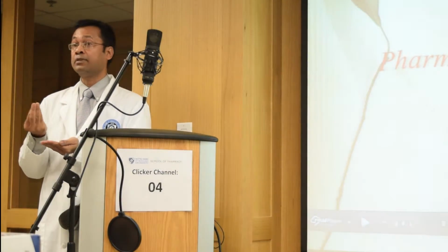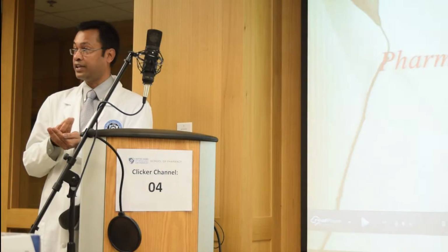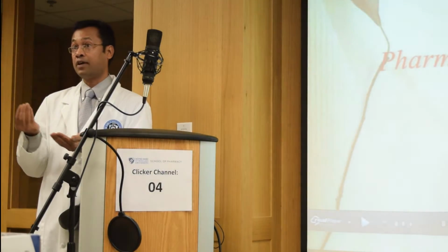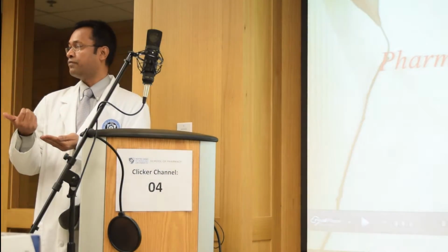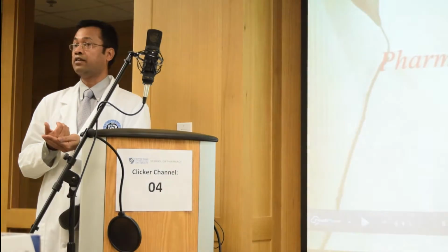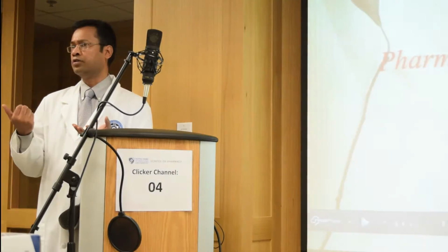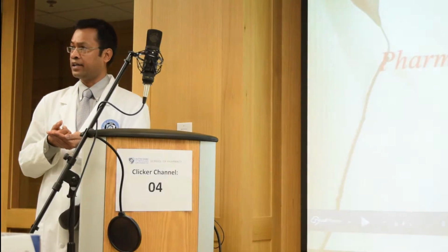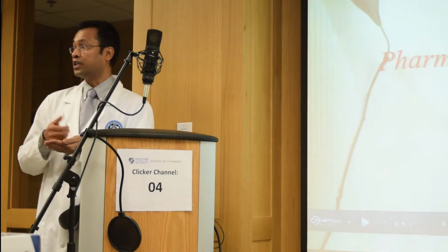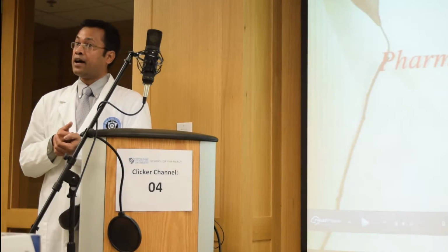And then using a simple process called trituration for pharmaceutical compounding, which is mixing the two ingredients as well as reducing the particle size. And forming a eutectic mixture, which is a very essential process in order to make a uniform mixture of substances that are very hard to grind, like camphor and menthol, with other emulsion bases or pharmaceutical ointment bases.